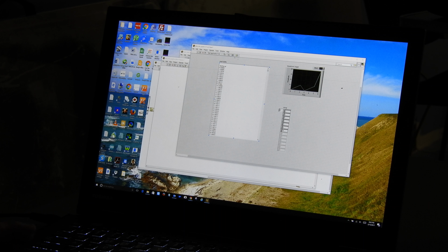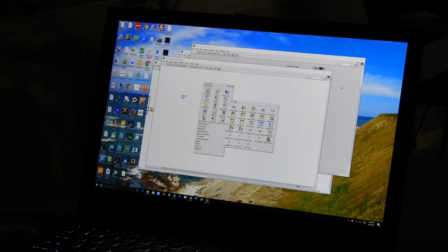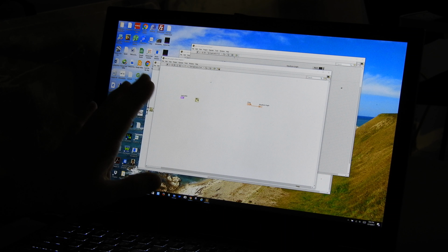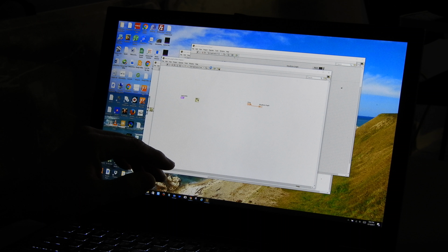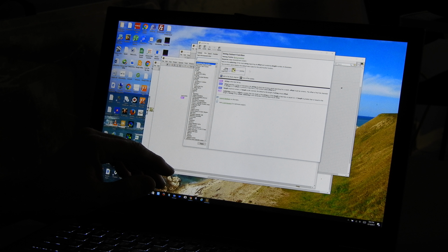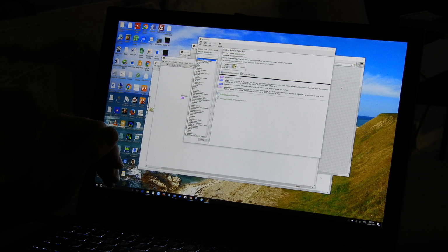I'm going to initially take this string that comes out, and I'm going to do a search within that string for a string subset. Maybe we'll look at the string subset function. Anytime I don't know what something is, it looks like they've made some changes to the string section here, you can just right-click on any of these VIs and click Help, and it will pop up a nice help function written by the people at National Instruments as to exactly what that function does.